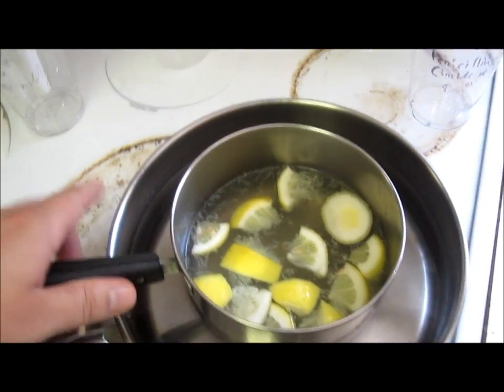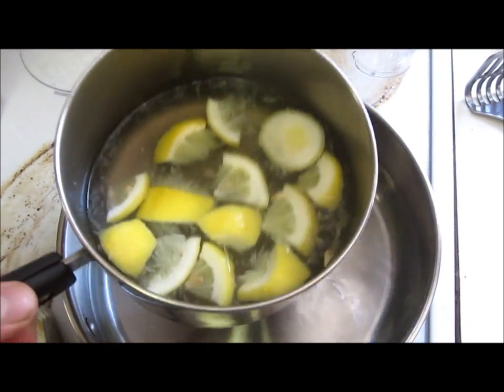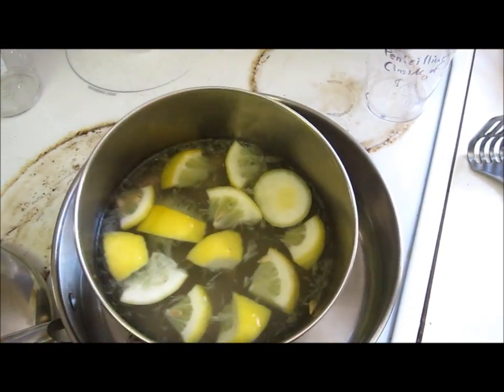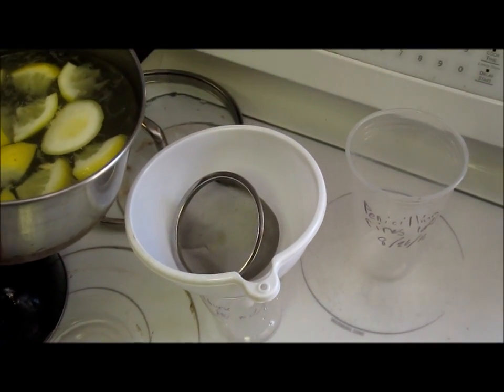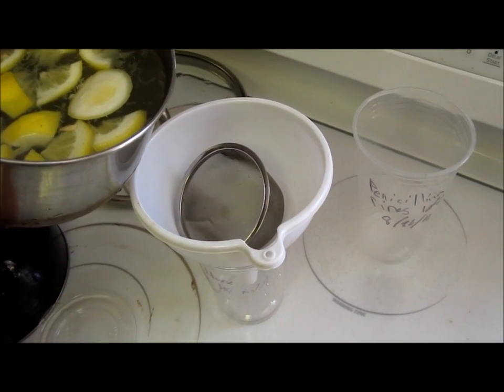Alright, so the lemon water mixture has cooled. I wish I had some pH paper to test the pH. I'm sure it's acidic, but a lot of fungi prefer acidic conditions.